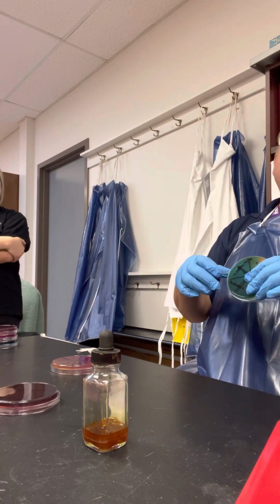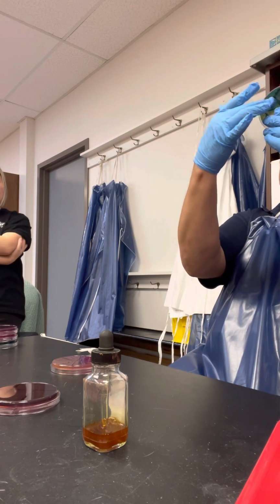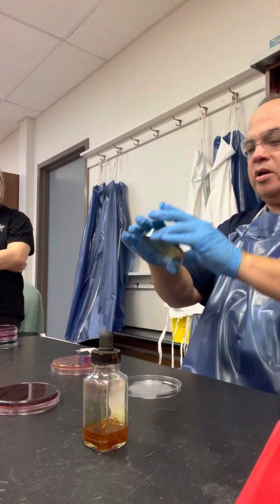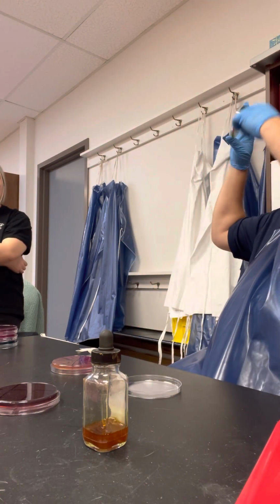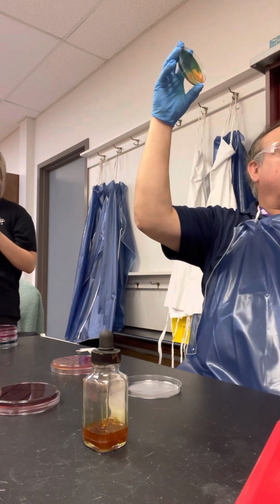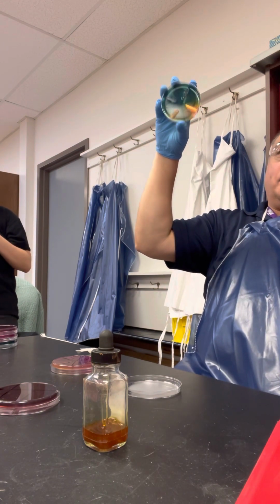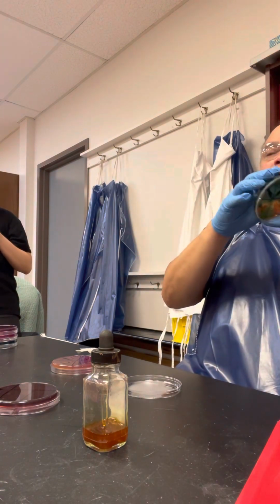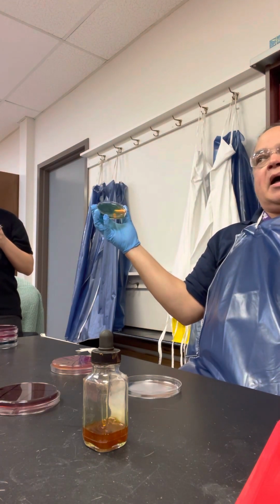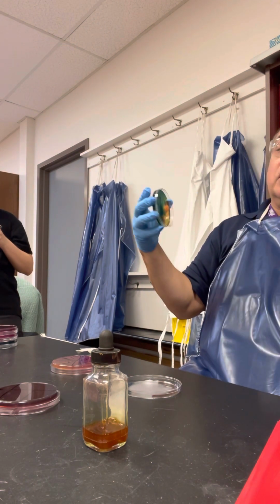So in order for them to be a lactose non-fermenter, they would grow, but the media would look kind of blue-greenish. You see that? So if it was blue-green, or blue-green with hydrogen sulfide black precipitate, then there's a possibility that it's Salmonella in this case. So we have to work it up more. Right, because if you look at this, Salmonella and Proteus look exactly alike on this plate. Proteus is not a pathogen in the intestinal tract, but Salmonella is.